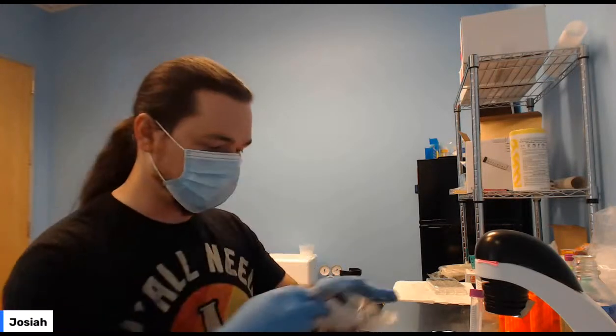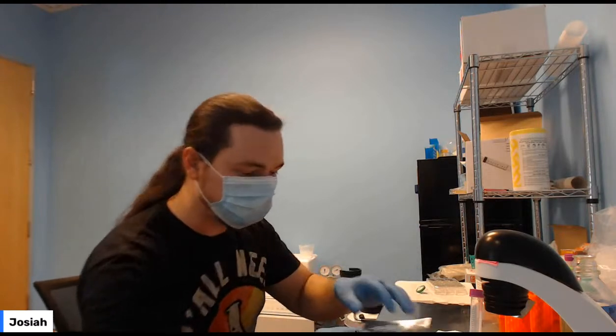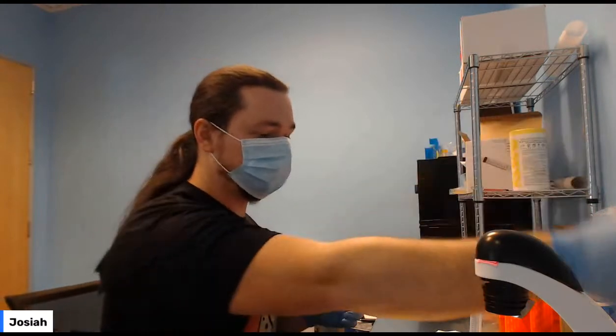So, with these guys, you're going to need a syringe filter. Again, try not to touch the smooth end if you can avoid it, because that's the end that's going to be going in your stuff.